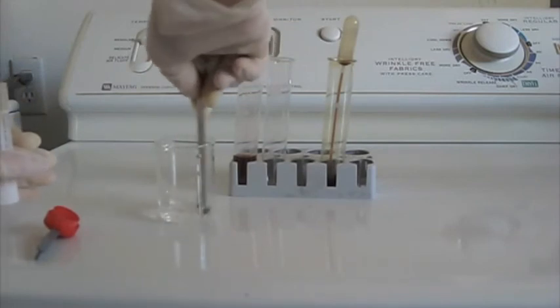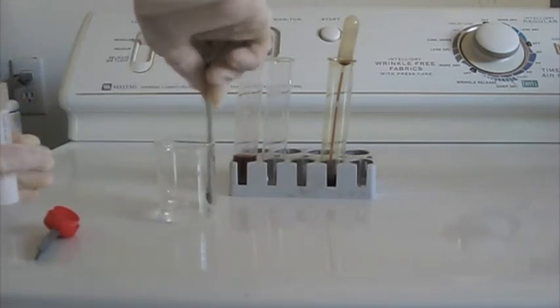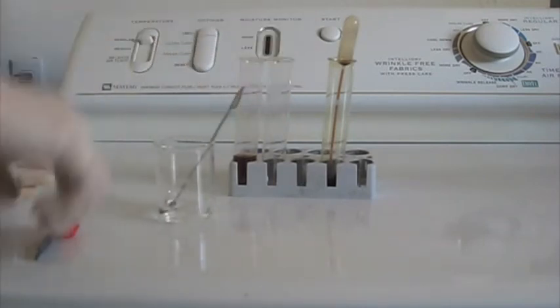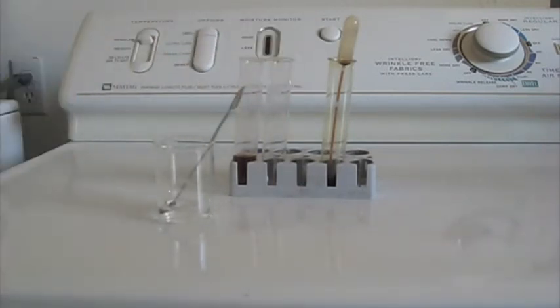I'm pretty sure the concentration doesn't matter, but according to what I think, the more concentrated the solution of sodium thiosulfate, the longer the iodine clock reaction would take.